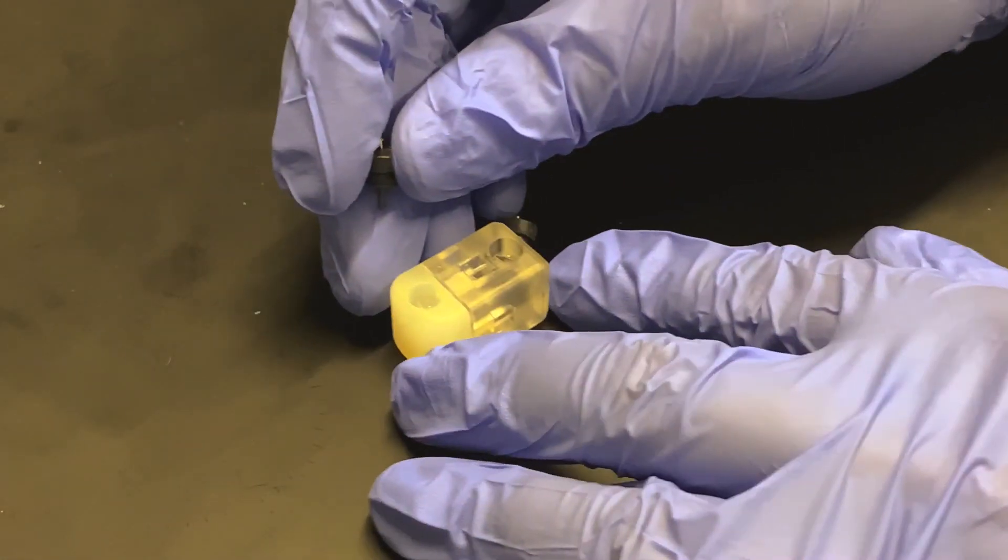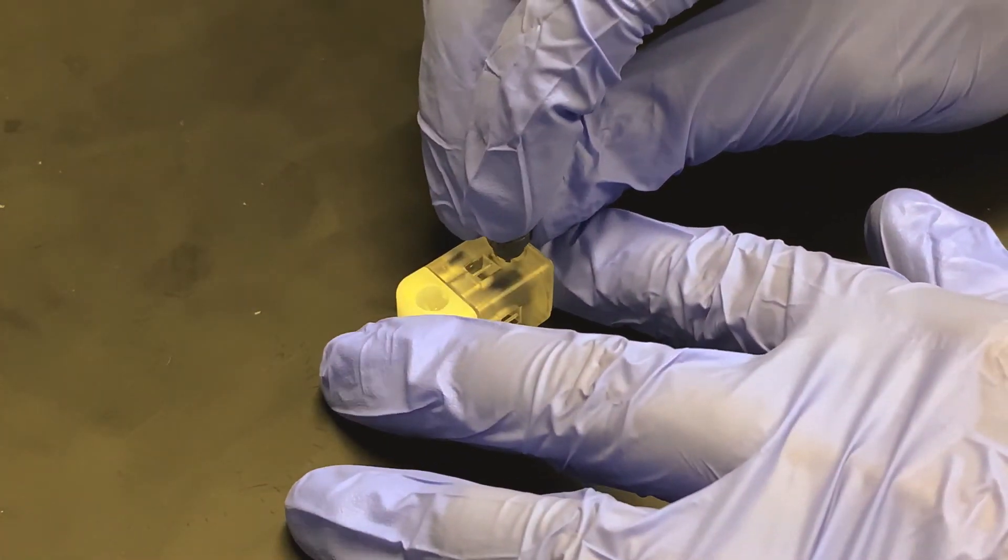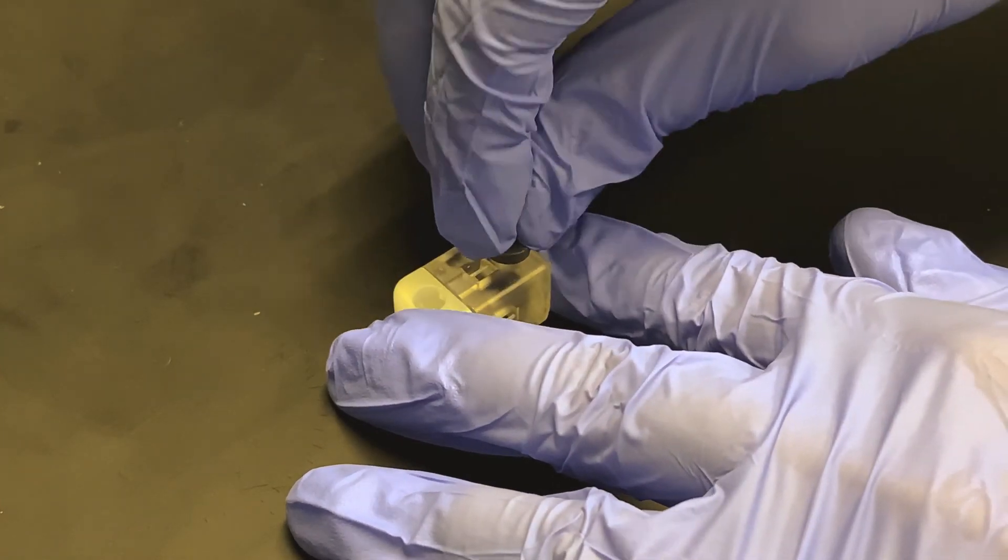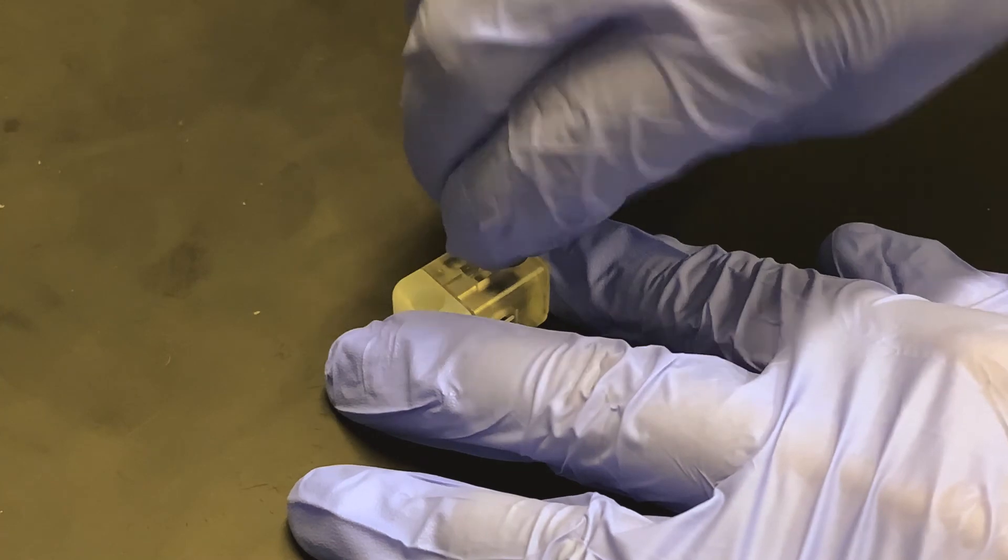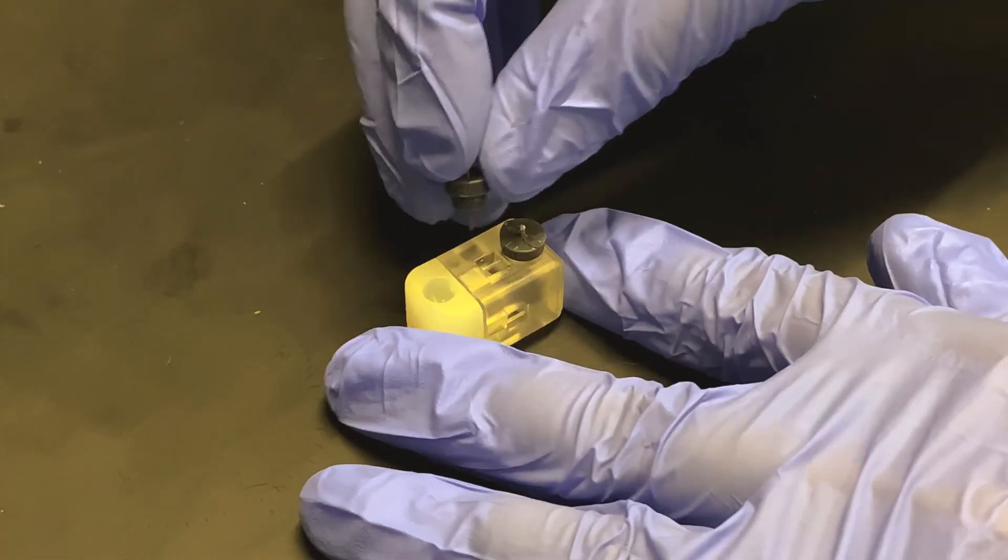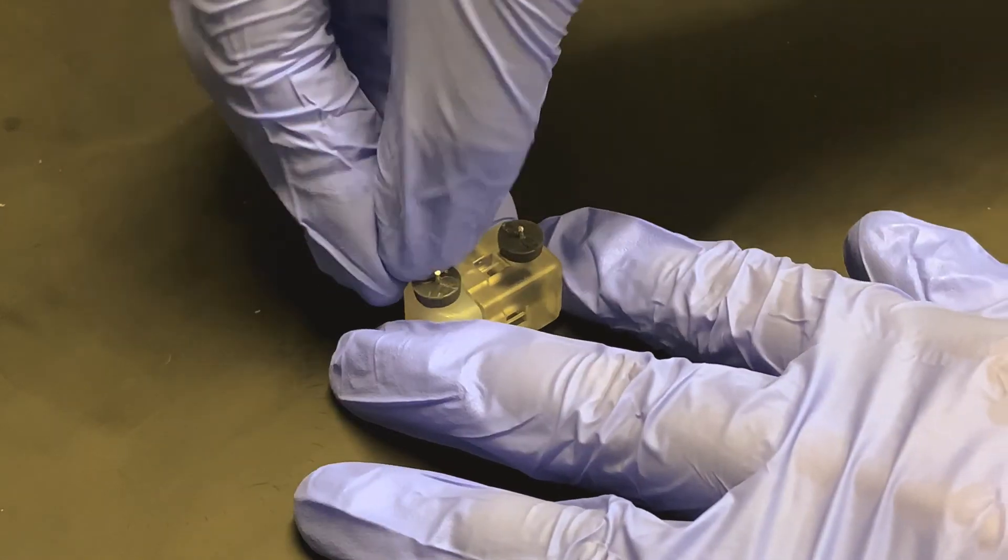Then I will take my cartridge and stick the electrode into the central channel, push down on the cap so that it's flush with the top face. I'll do the same with the other one and push down.